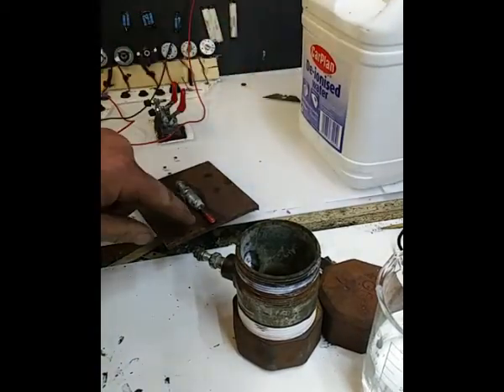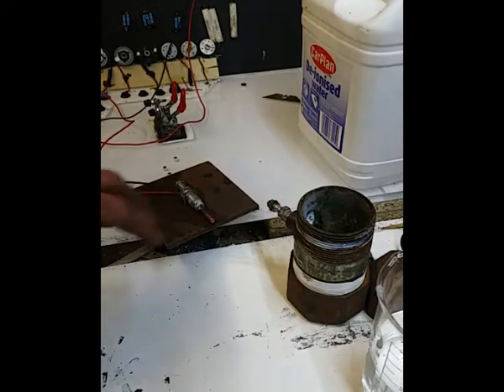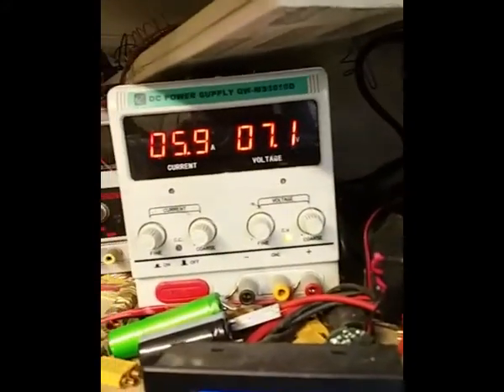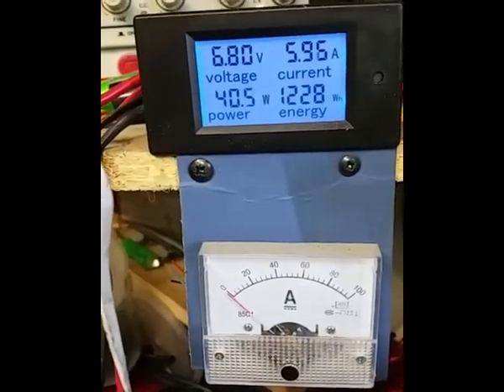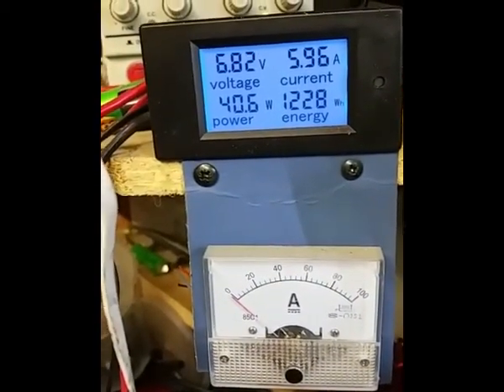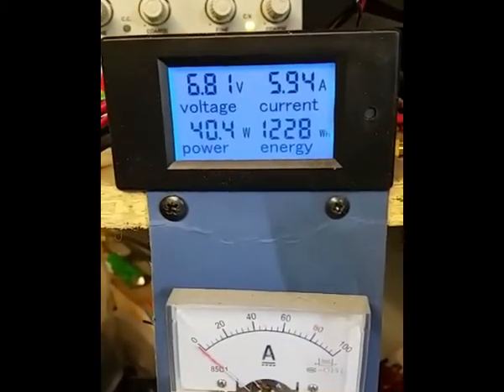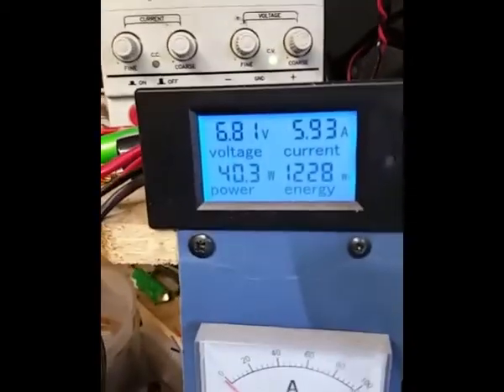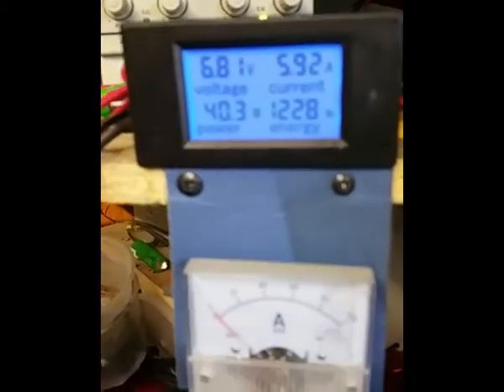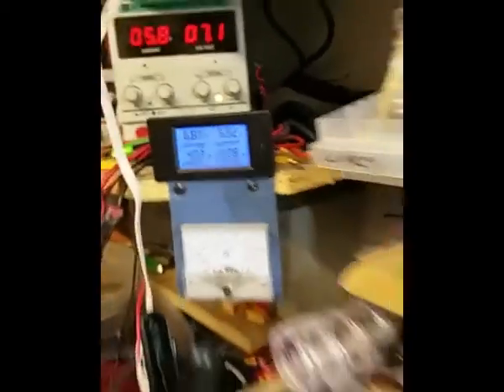Now I've got this set up, it's drawing, let's see, we've got 7.1 volts, 5.9 amps, and well, 40 watts basically, although that particular meter there doesn't agree with the voltage of the power supply. Well, 7.1, 6.8, you know, which one do you believe? I don't know, but anyway, that's that.